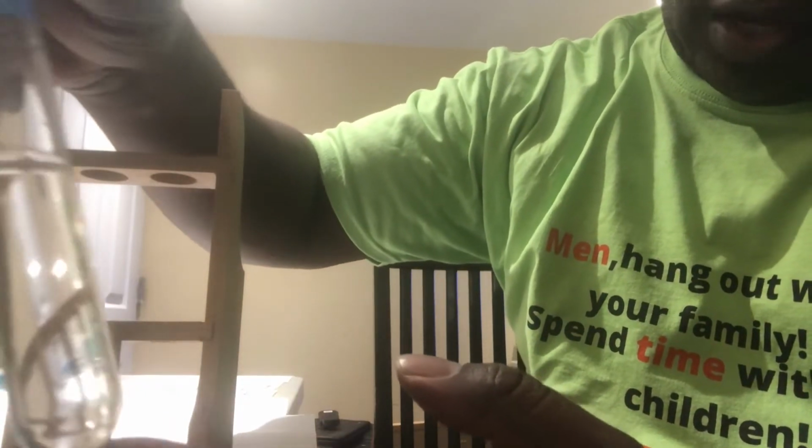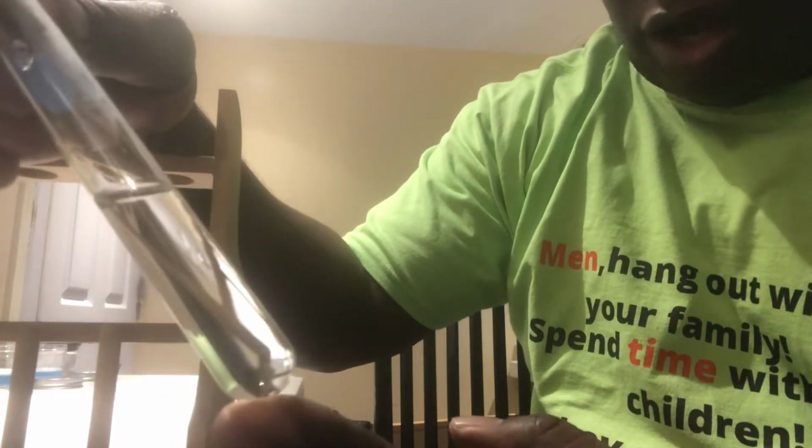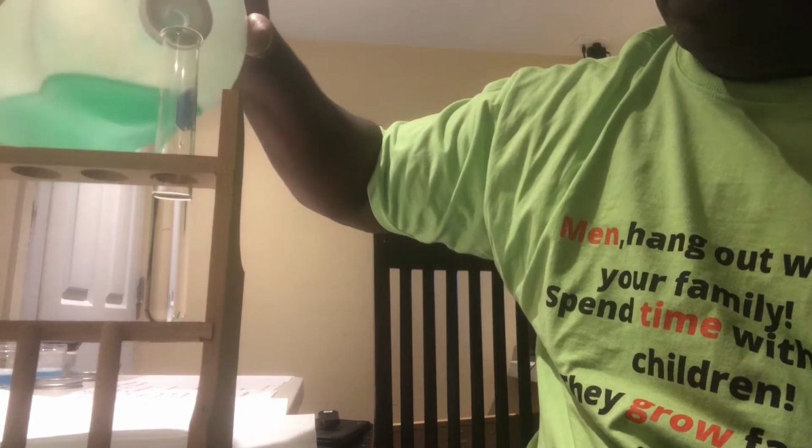All right, guys, I just put some peroxide in this test tube. Now, if you notice, it's pretty normal, not doing much. But it's decomposing very, very slowly into water and oxygen, right? Honestly, you can't really see anything with the naked eye right now. So what we're going to do is add a catalyst to it and see what happens. Now, as I said before, we're going to add a little bit of soap. So let me pop some in there, just a tad.